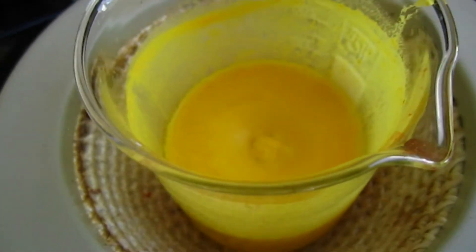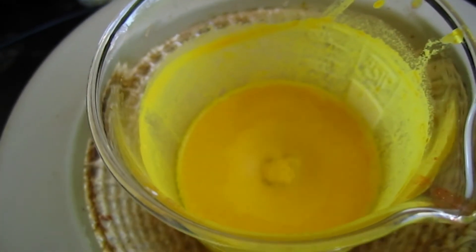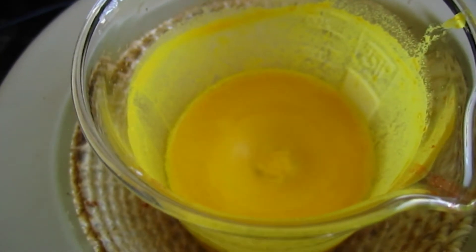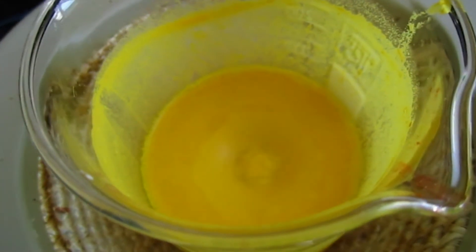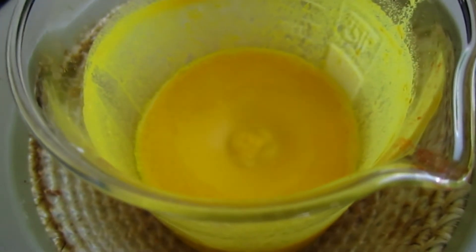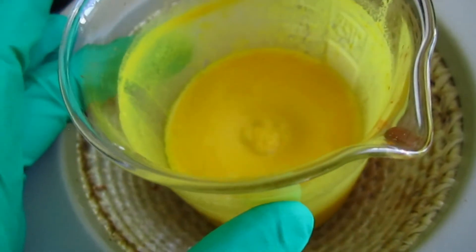So now that I have added the sodium acetate, I'm just going to stir it on for like 30 minutes and keep the temperature under 20 degrees Celsius. I actually employed a magnetic stir bar to do it.